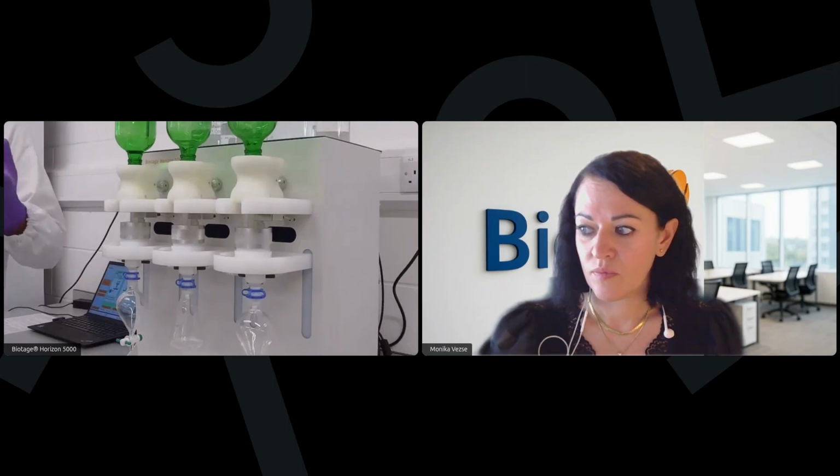There is oil and grease analysis that you might do gravimetrically by just extracting the sample and then weighing your leftover hexane extractable material, or you might want to analyze the different oils and fats or different oil index via GC. And all of these are supported on the system. And we do have application notes already for all these applications that you can find online.